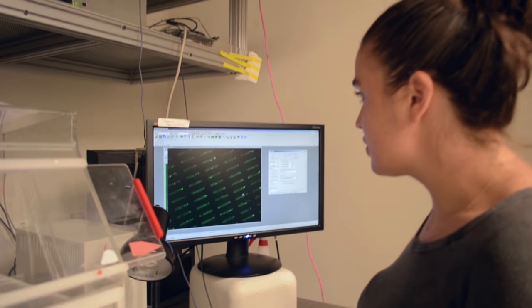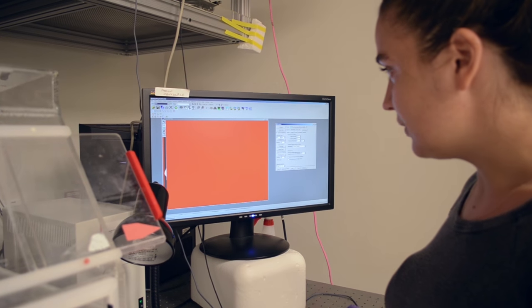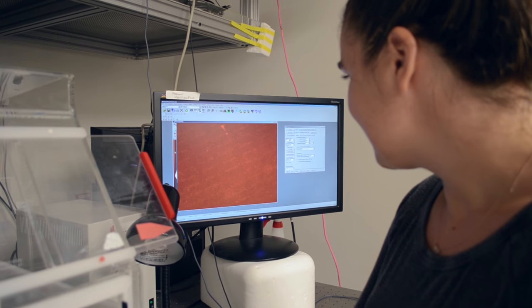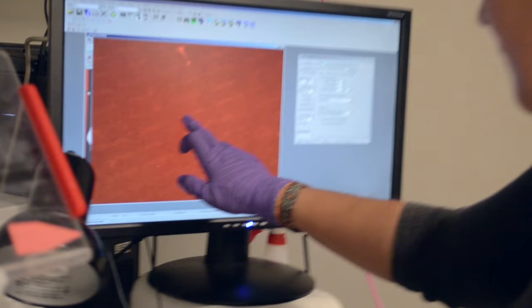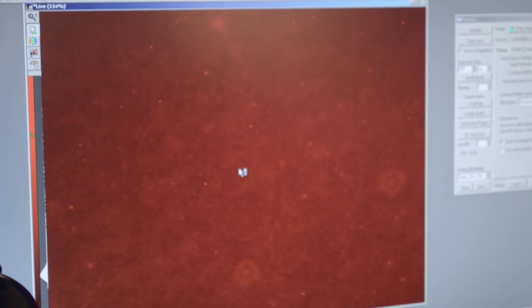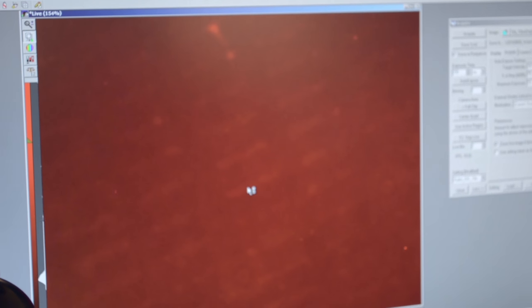And then we can switch to a different color. You can see the beads. Little overexposed. So you can even see that the beads cluster a little bit in these regions where we had the protein patterns. I don't know if you can see that. Can we bring the brightness down a little bit? Oh yeah, now we can see that they're beads. They're very tiny beads. Very tiny, yeah. You can see when I focus through.